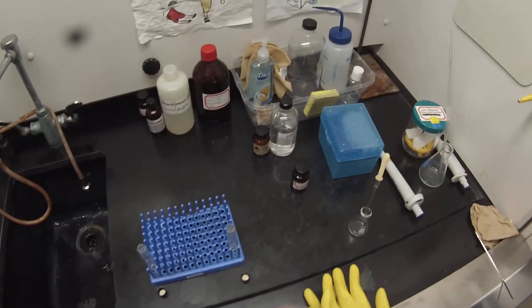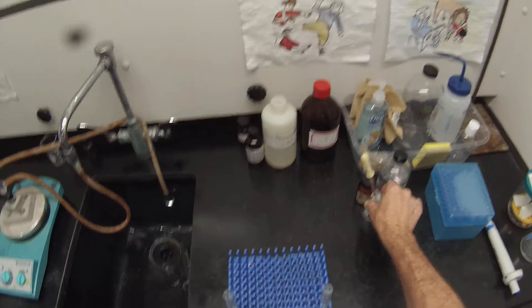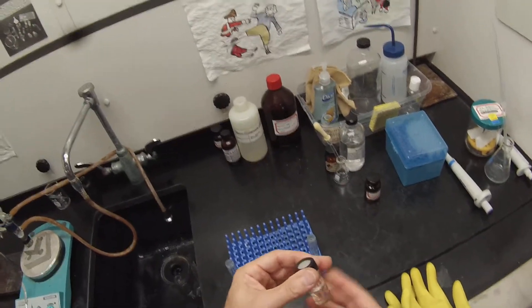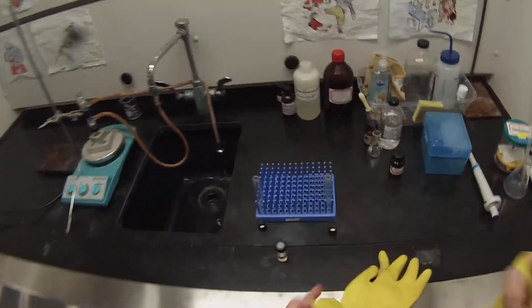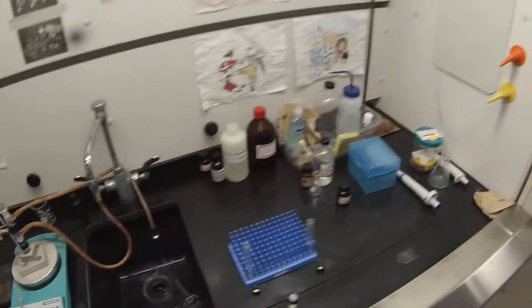I'm going to use this again later, so I'll just set it aside. This was for the pentane. And it will be used again to remove the layer. So I'm going to stick the cap on here so it stays anhydrous. And I don't trust this centrifuge cap not to leak. So I am going to wear my gloves when I do that shaking. Back up at 140 on here, so that's looking good. It's refluxing again. And reflux lines there.